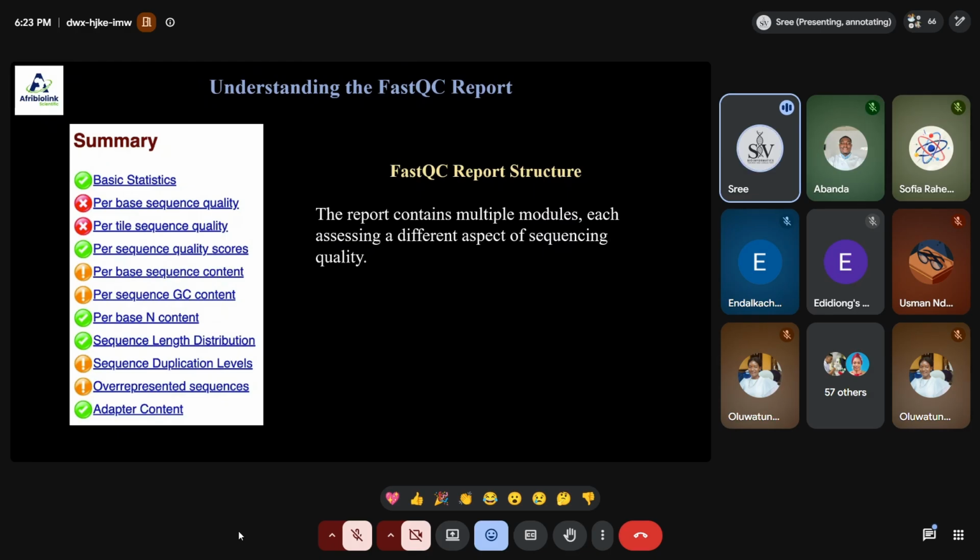This is how we see the report, right? The summary of the report. The report contains multiple modules. It has information about basic statistics, per base quality score, per tile quality score, per sequence quality score, per base content, per GC content. All this information will be there in the report. Someone asked in between what determines the quality scores, right? This all determines the quality scores. This is all very important before performing the downstream analysis.